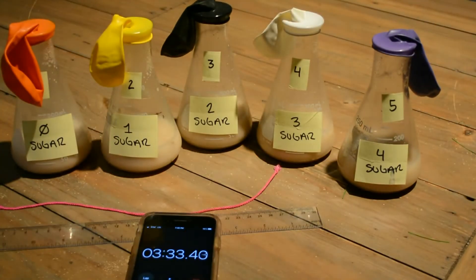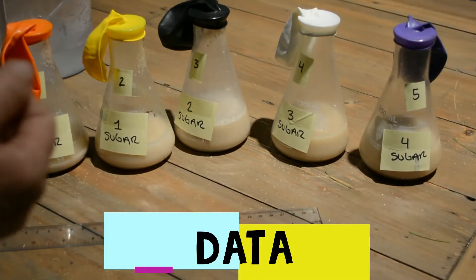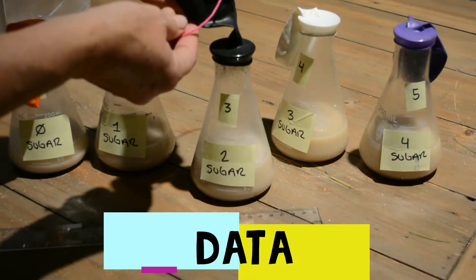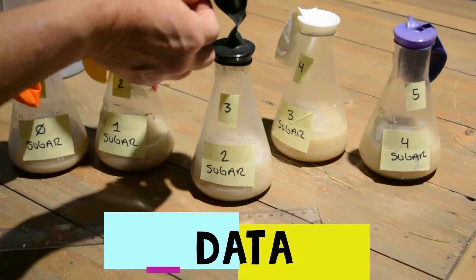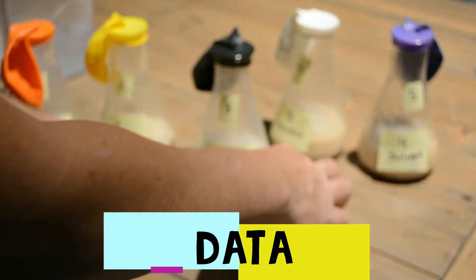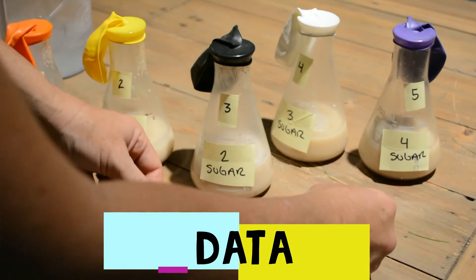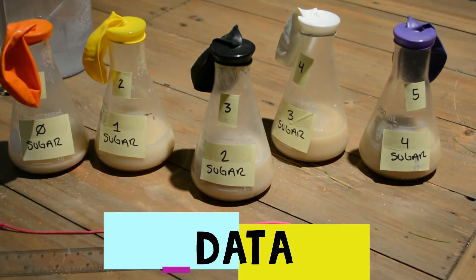At the five-minute mark we're going to go around and measure the circumference of all the balloons. Be very gentle and don't push the CO2 back into the jar. Wrap the string around the balloon, mark where it meets, and then use that string to measure up to the centimeter side of the ruler. I'll show you the data on a separate slide — go ahead and stop the video and write that down.